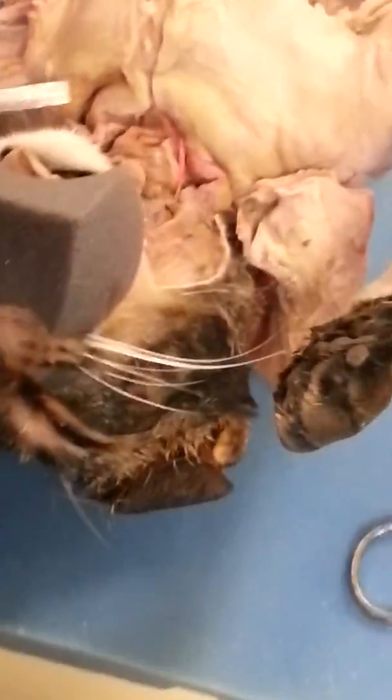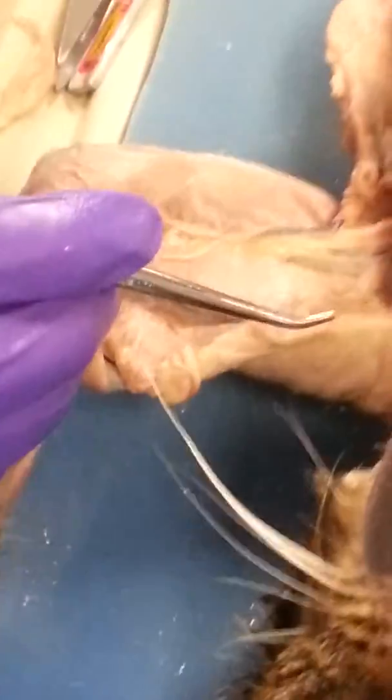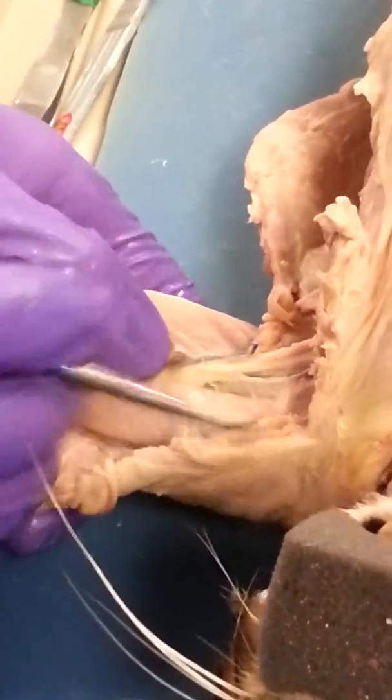Trapezius. I got it. Geometry, right? It is. Well, that's where the names actually come from. They're named after geometry shapes because they roughly resemble those kind of shapes.